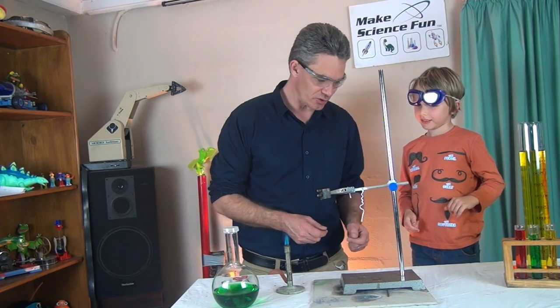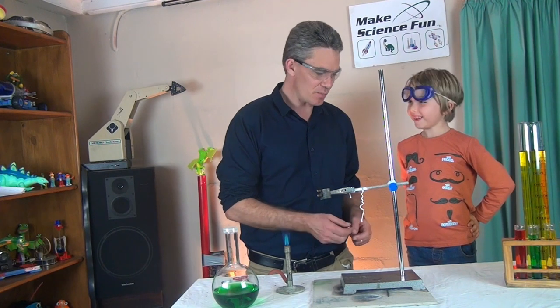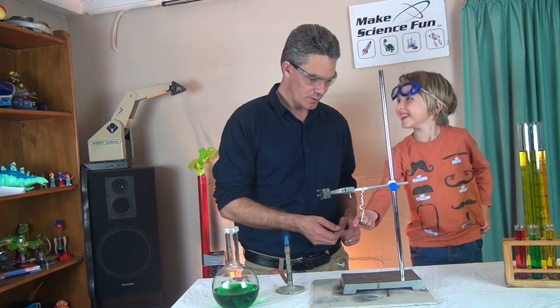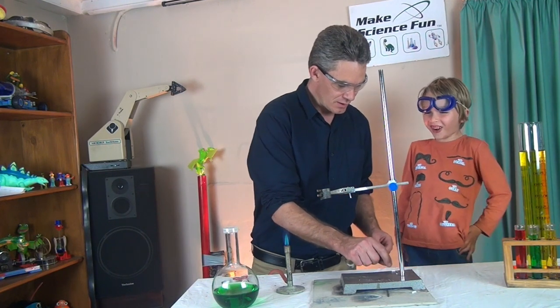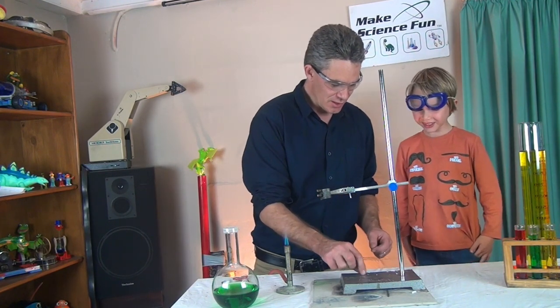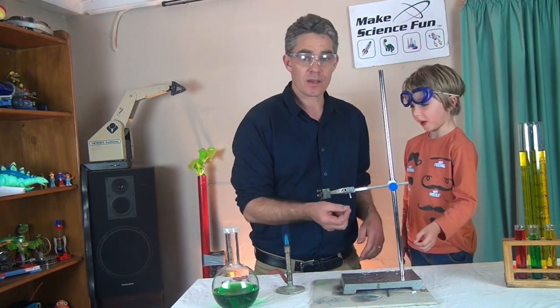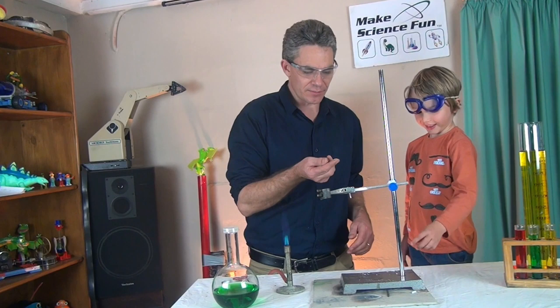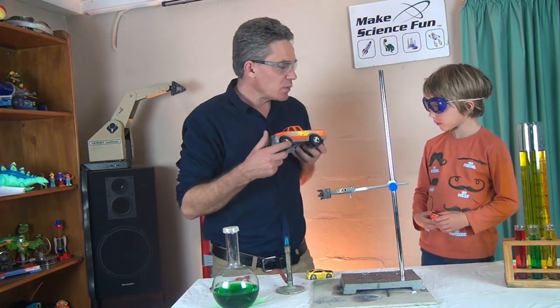Look, what's it turned into, Sam? Shell. You can actually touch that. It won't burn you. Yeah, you can touch it now. It's a white powder. Do you know what this white powder is called? Magnesium oxide. Magnesium oxide.